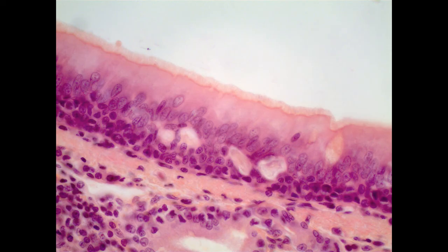And so microvilli, which we saw previously in the intestines, are associated with absorption and added surface area. Whereas here we have cilia, and it's the ability to move that allows these features to move mucus through, which is important in the respiratory system. So we can call this a pseudostratified, ciliated, columnar, epithelial ET with goblet cells.